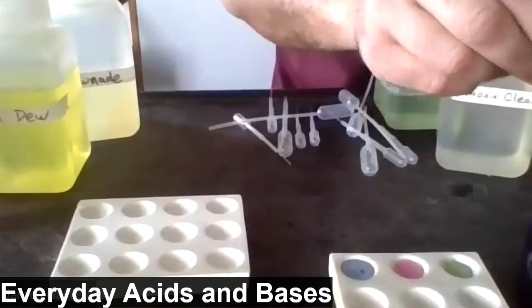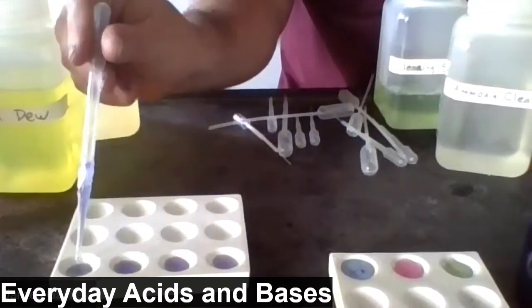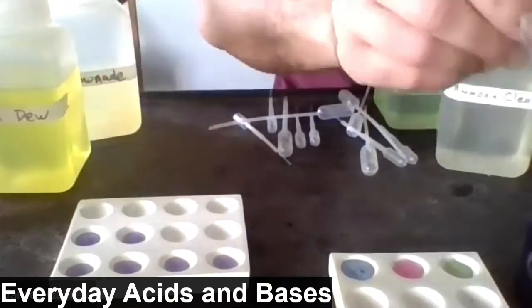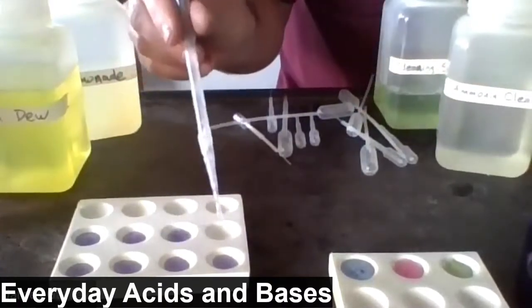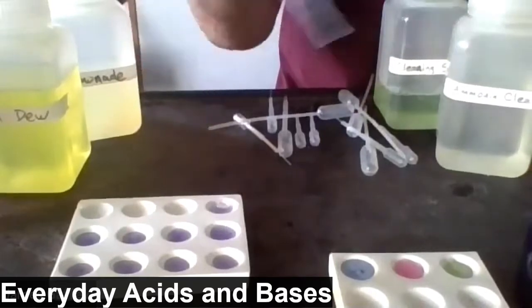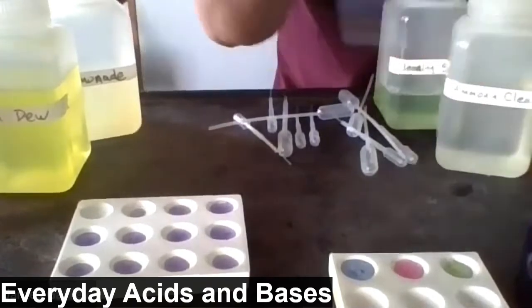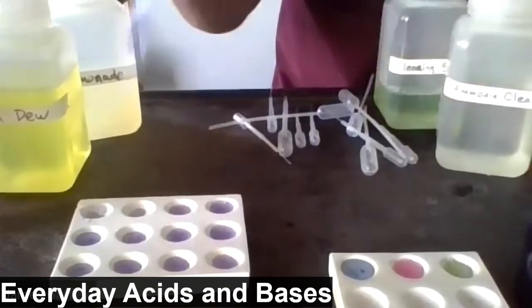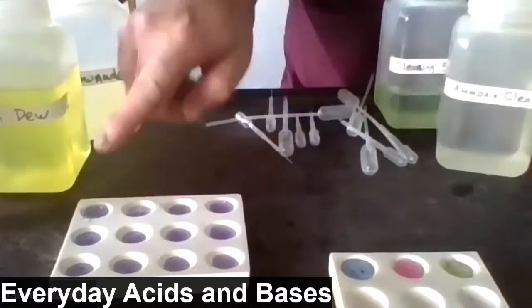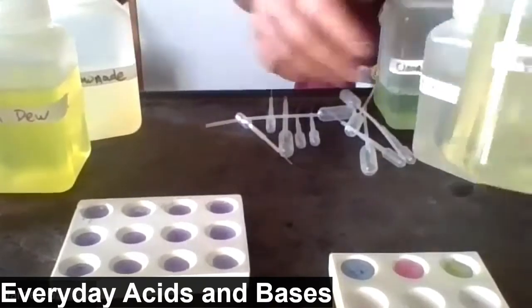Now, let's play around with some household substances. I'm going to add cabbage juice to all of the wells. Put about 4 or 5 drops in each of the wells, and then we're just going to test some things. In the data table, I'd like you to record what you see in the standards. And then in just a moment, one by one, we'll test some household substances. Okay, so we've got the cabbage juice added to all 12 wells. Now, one at a time, we're going to test these substances.